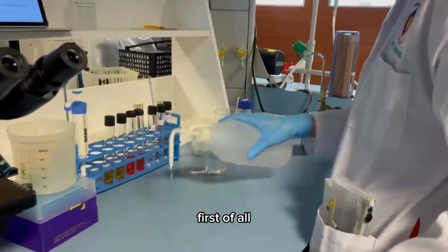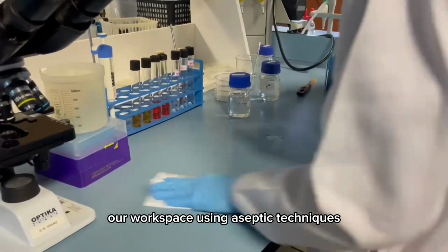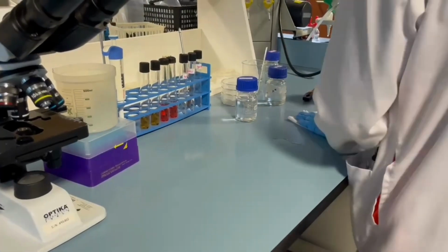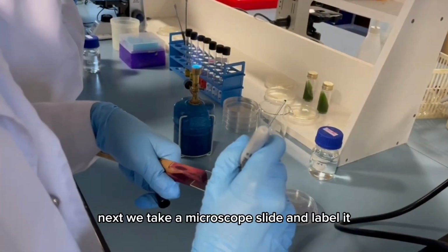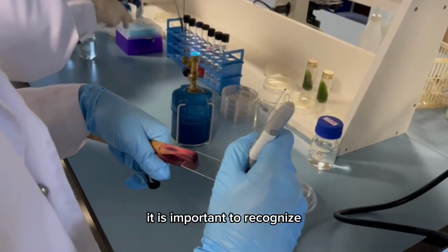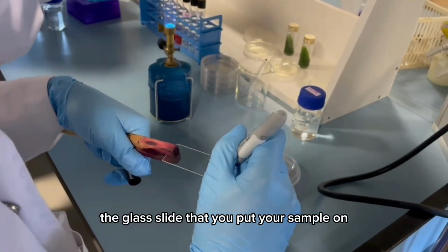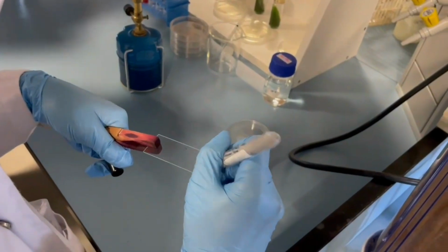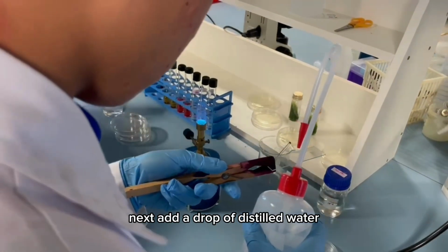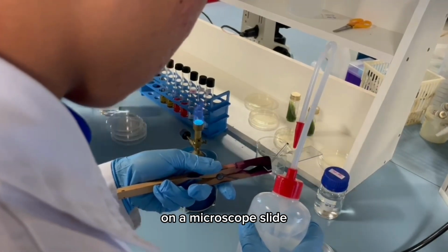For the methods, first of all, we need to clean our workspace using aseptic techniques. Next, we take a microscope slide and label it. It is important to recognize the glass slide that you put your sample on. Next, add a drop of distilled water on a microscope slide.